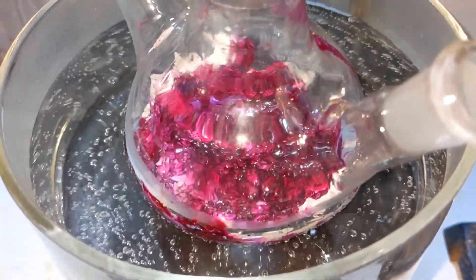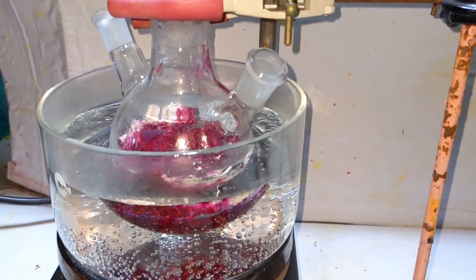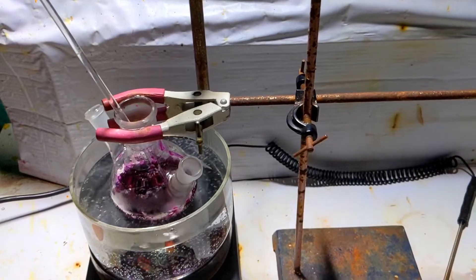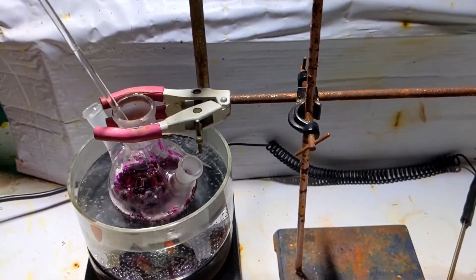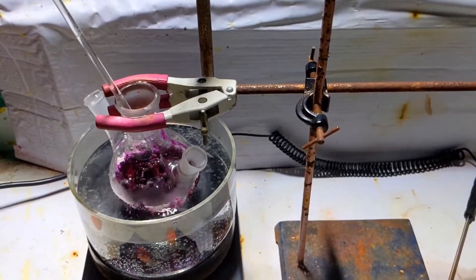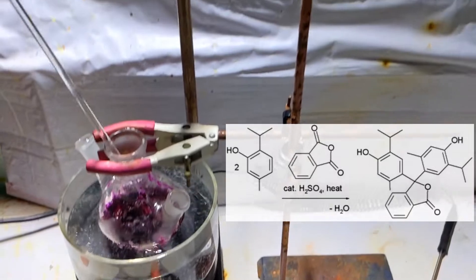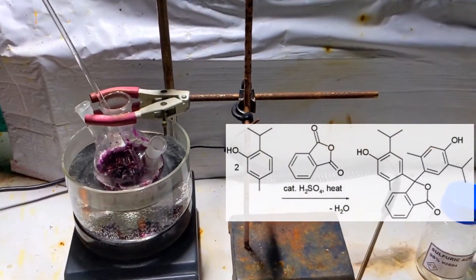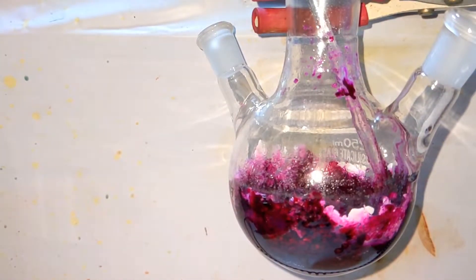It was heated for around 15 minutes at around 90 degrees Celsius. You can see how the whole stand, clamp, and everything is shaking because the magnetic stirring bar is stuck inside the compound, which has already solidified. What is happening here is the condensation of two moles of thymol with one mole of phthalic anhydride in the presence of sulfuric acid to form thymolphthalein.